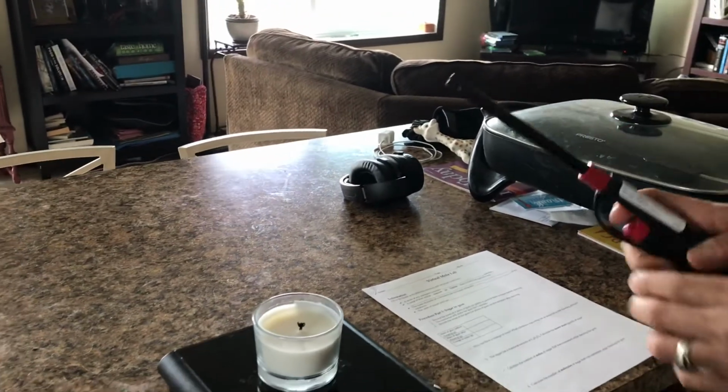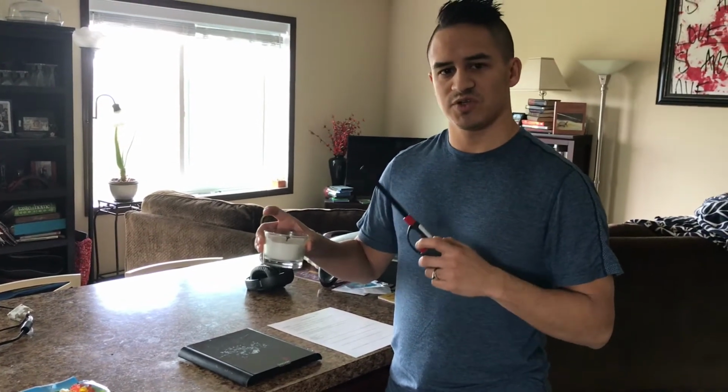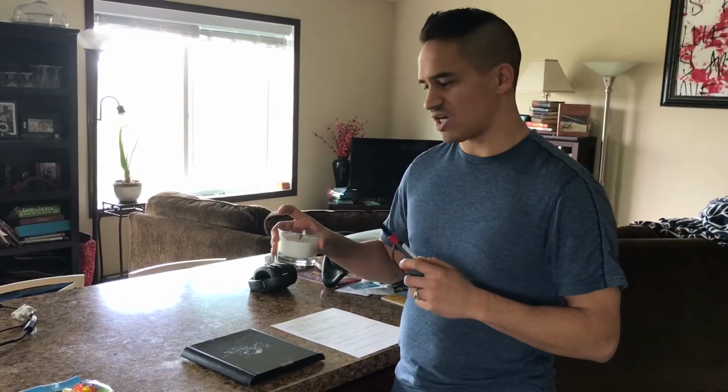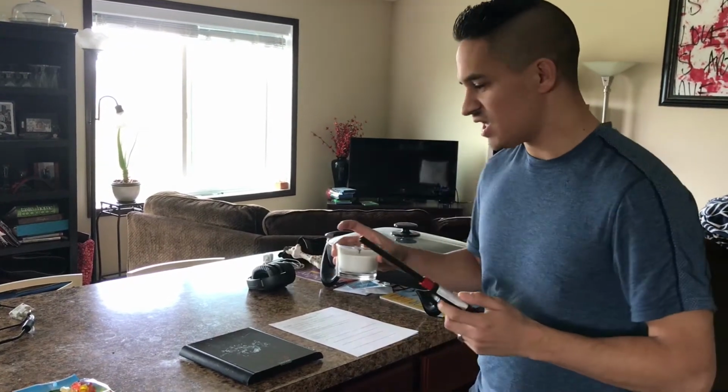And then what we're going to do is burn this candle for 15 minutes. And then after 15 minutes, we're going to weigh it again and see how much wax has been removed in that burning process. And then from there, you're going to do some calculations to figure out how many moles of wax was burned and molecules and atoms of carbon and things like that.